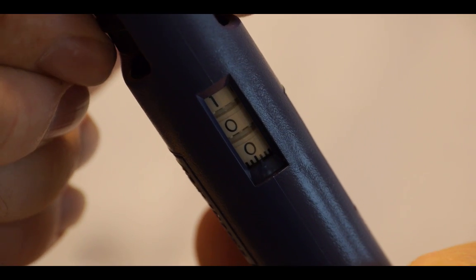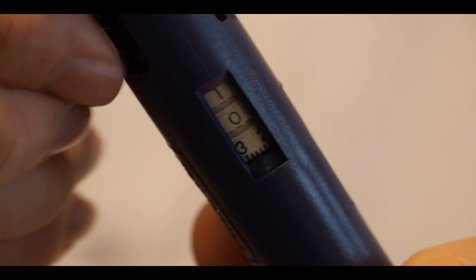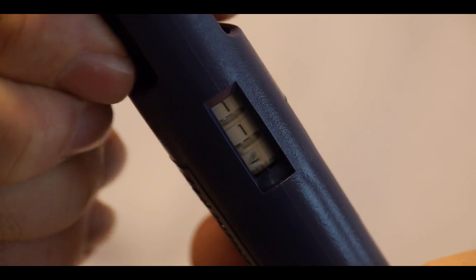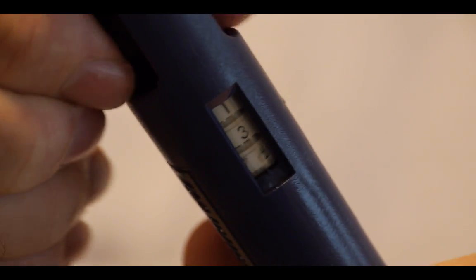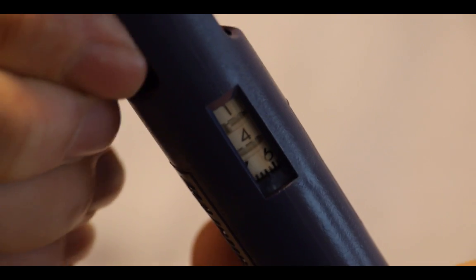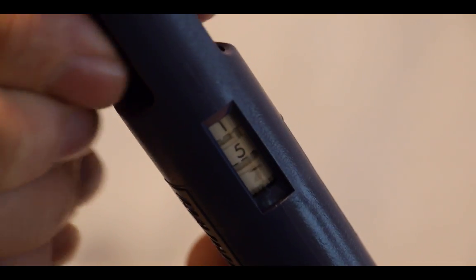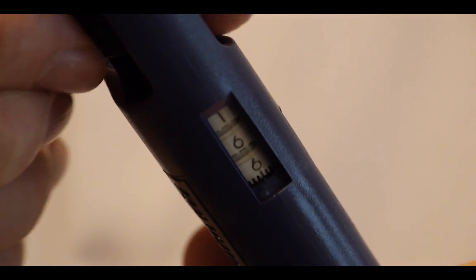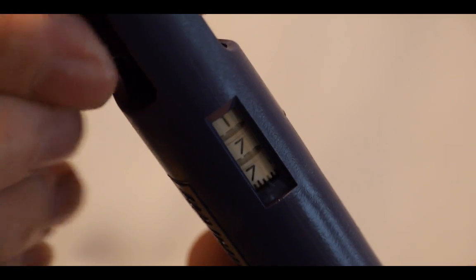The P200s and P20s, for example, are set in the same way by rotating the black wheel at the top, but in this case the number in the window reads the exact volume. In this case we are setting a P200 to 200 µL.